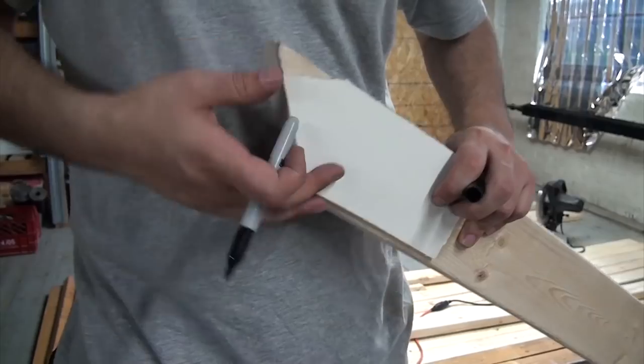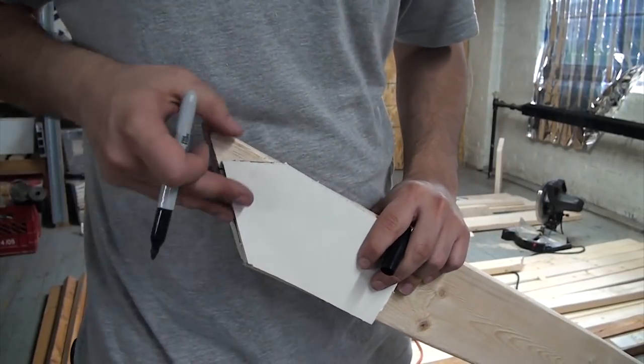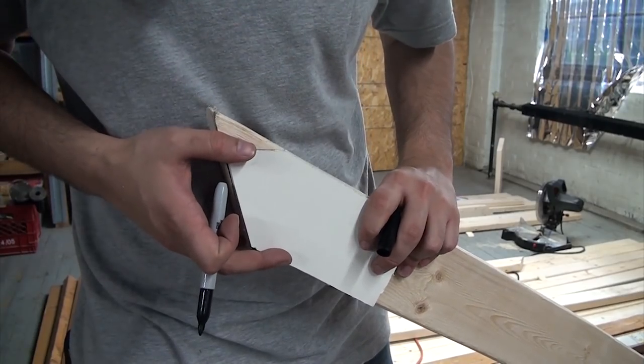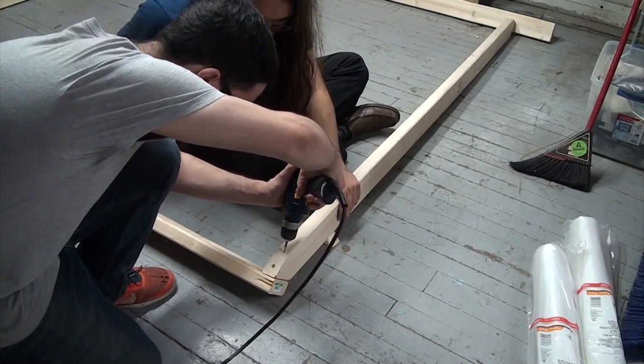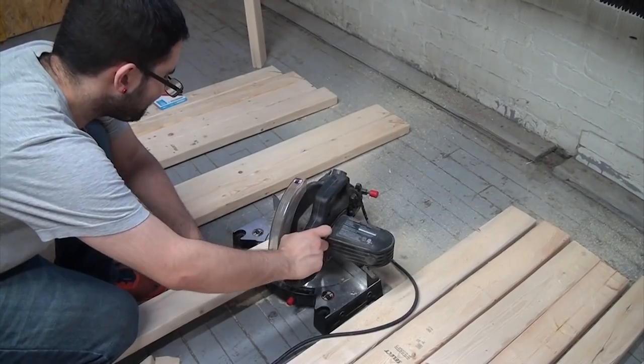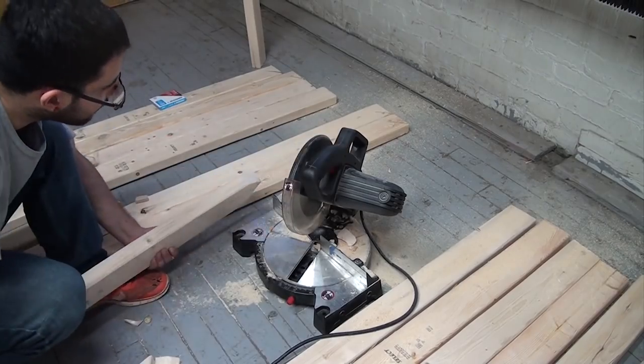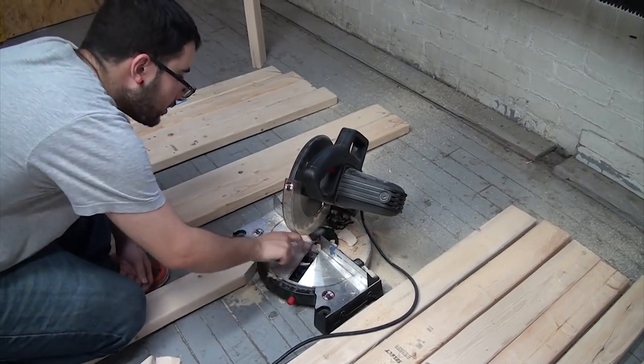After measuring out all the wood and cutting most things to length, we got started on making the two end walls. After cutting the ends off the top and bottom beams to have their 45 degree miters, I realized that I should probably trim them to length so that the miter is only as long as the 2x4 that'll sit in here, so that there aren't two pointy bits hanging out the back. So a second cut at about 30 degrees was made in the opposite direction. This was sort of sketchy to do on a chop saw, so use a better tool if you do this.